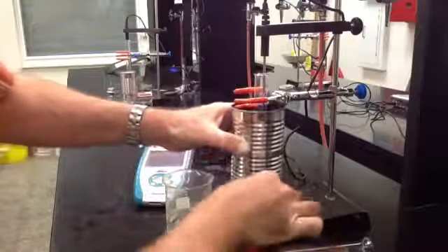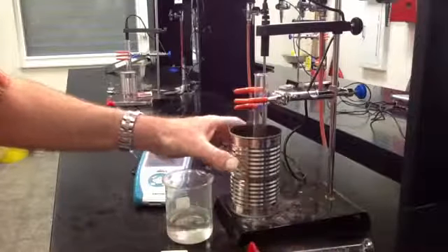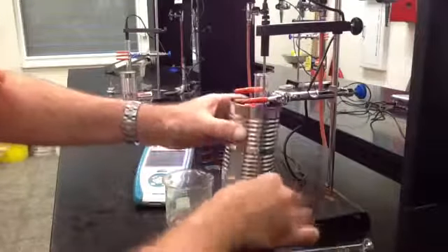You will take your food item - it'll be a nut or gummy bear - and put it on the pin here. Place this underneath.